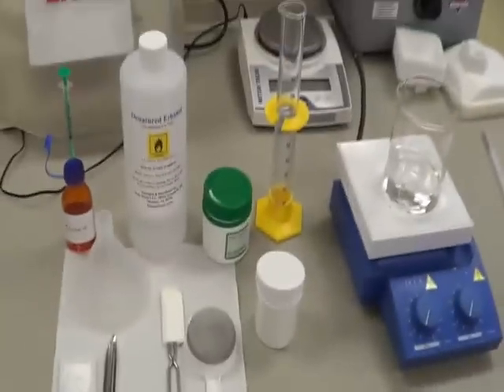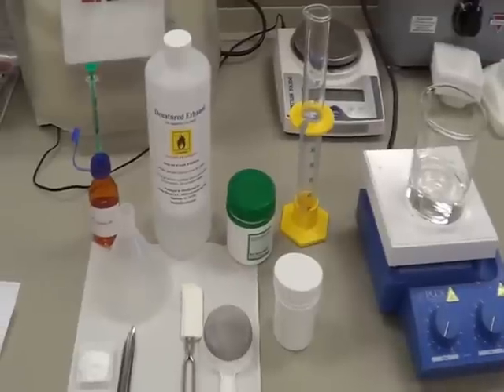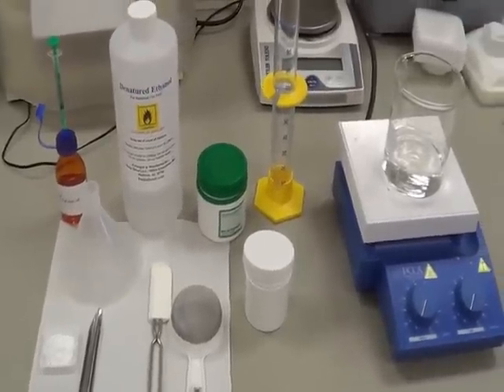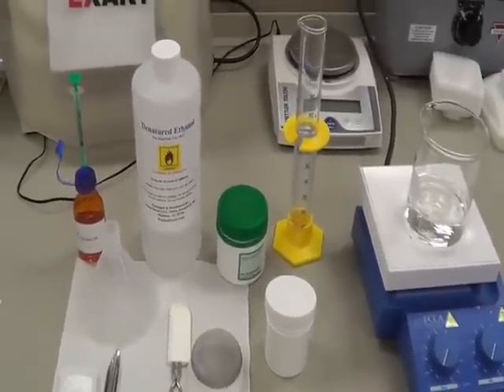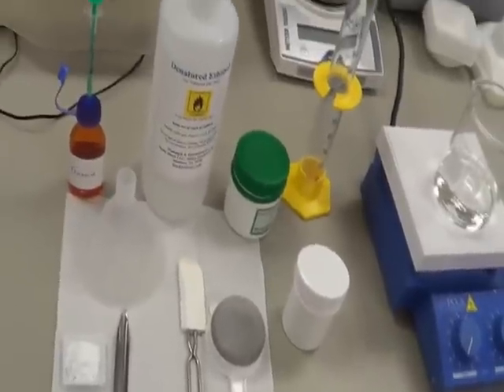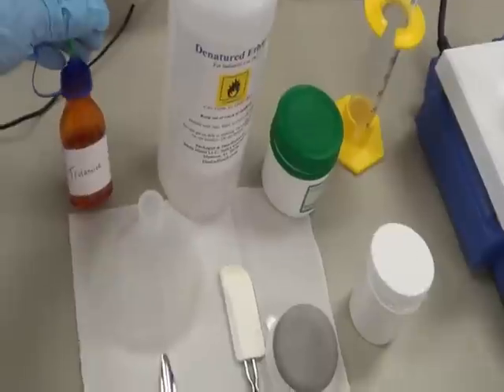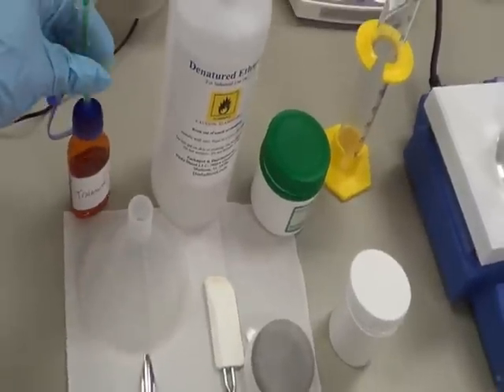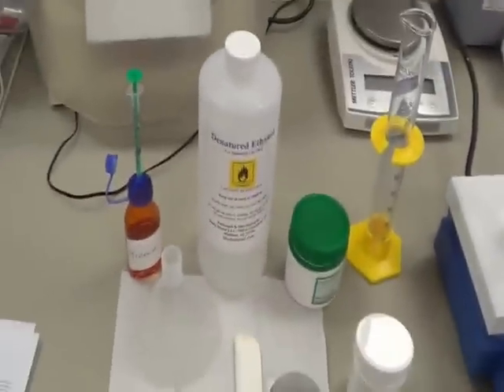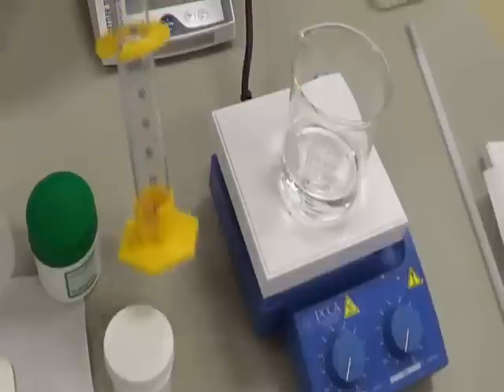Welcome back. Today we are preparing a hand sanitizer. Basically it's a carbomer gel — a hand sanitizer is nothing but a carbomer gel. For the carbomer gel preparation we need triethanolamine, that is also an ethanolamine, and we are using 70% ethyl alcohol.